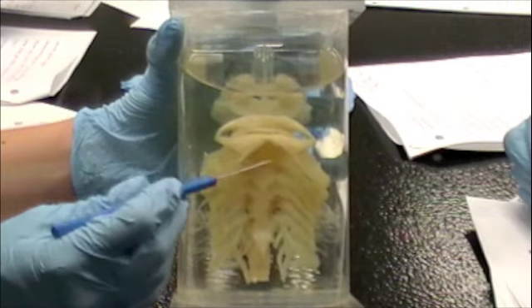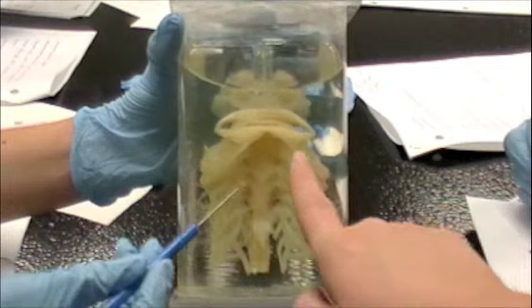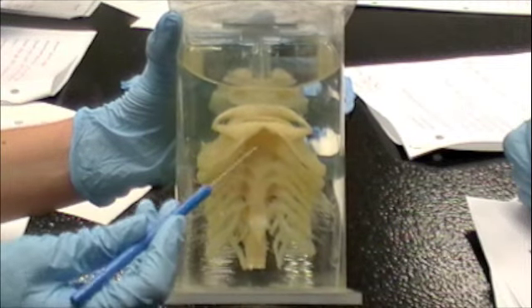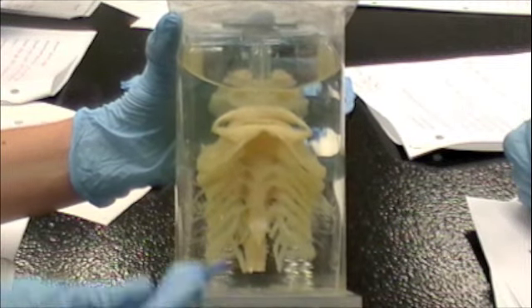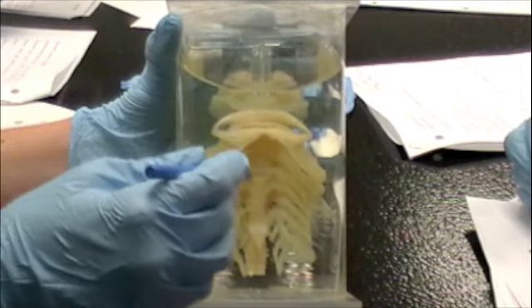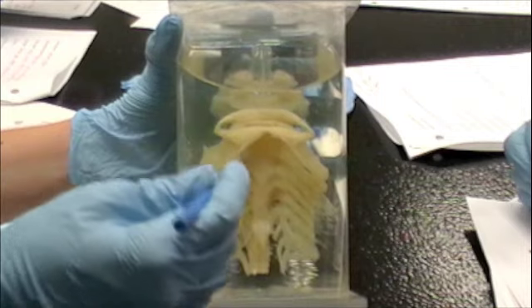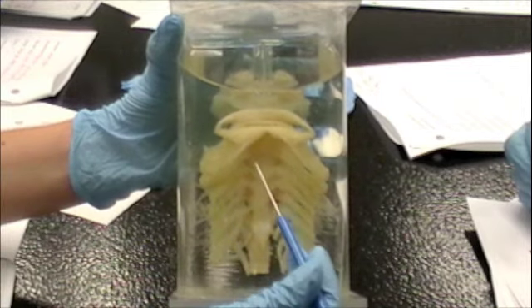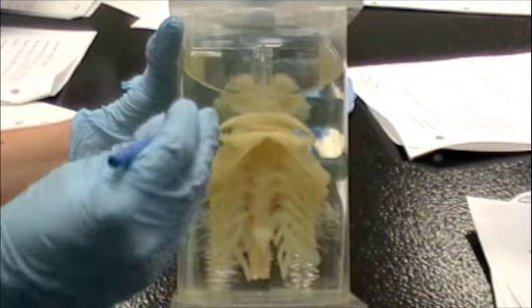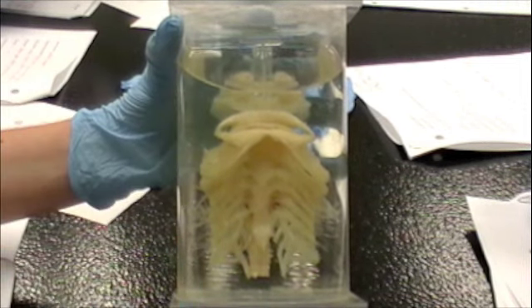This arch is the hyoid arch — underneath the mandibular arch. Underneath of there — so it's not this thing up here. The mandibular arch is both of the jaws — the top and bottom. The hyoid arch is underneath. What is this in the center? That's just where the teeth are attached.